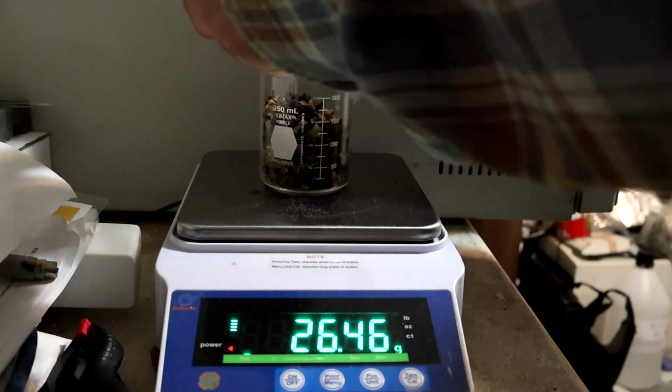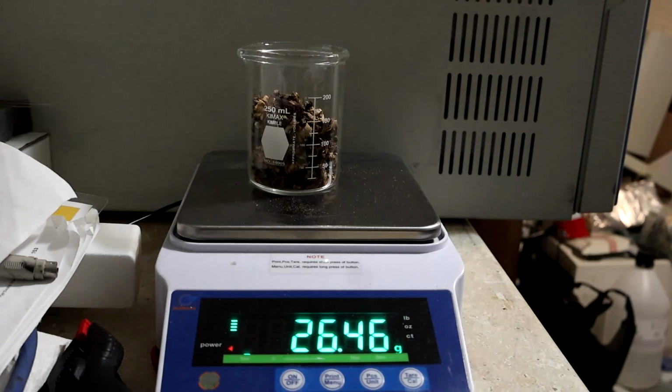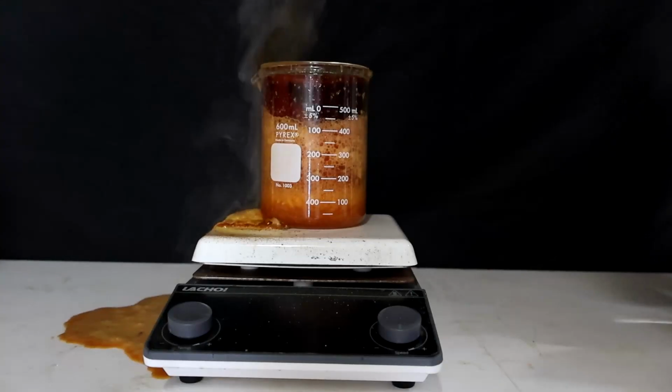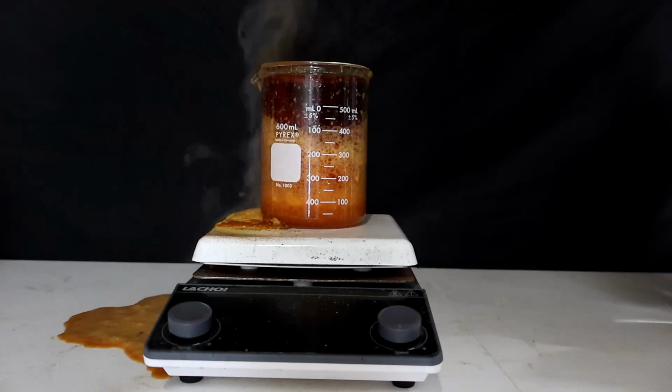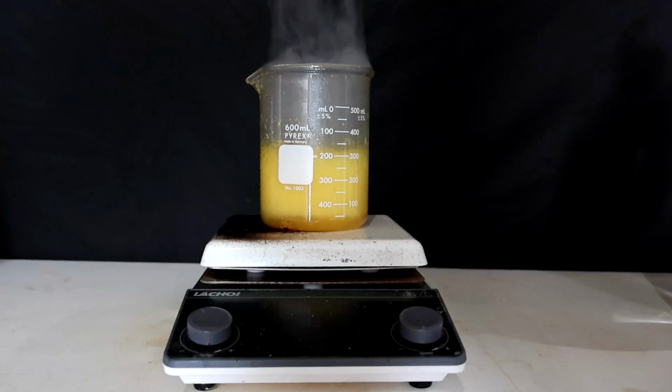That's enough. I weighed about 26 grams of dry Chernobyl shrooms, to which I added 120 milliliters of nitric acid and heated to 97 degrees. This may have been a bit too much. When the red fumes finally stopped, I let this cool before adding 40 milliliters of 35% hydrogen peroxide, and when the bubbling stops, I evaporate it to dryness.